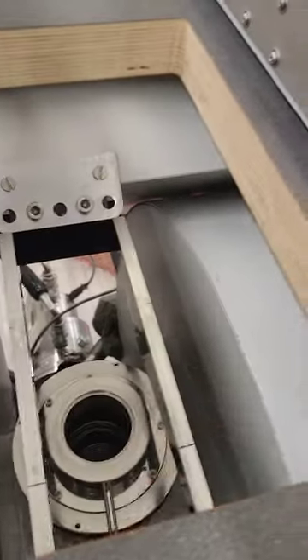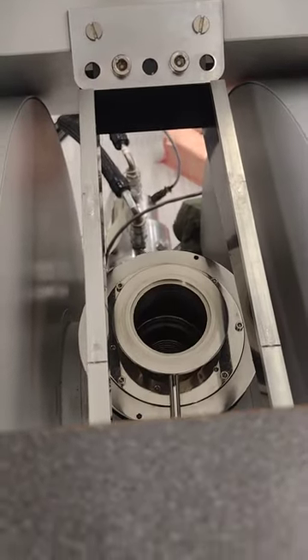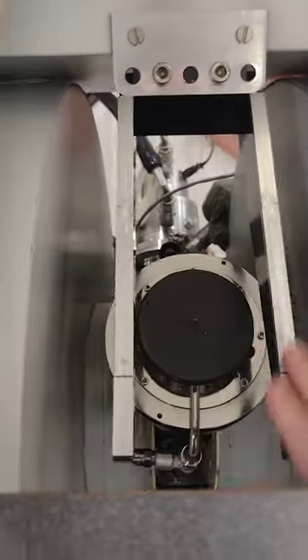Don't forget to grab this little O-ring — you don't want to lose it. You certainly don't want to donate it to Cold Edge whenever you ship it off to them, because it might not come home. I also have one of these little seals just to keep the dust out, although if you look inside this thing it's quite dirty.